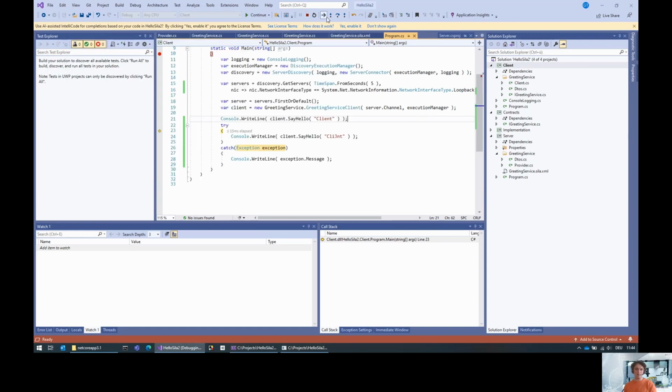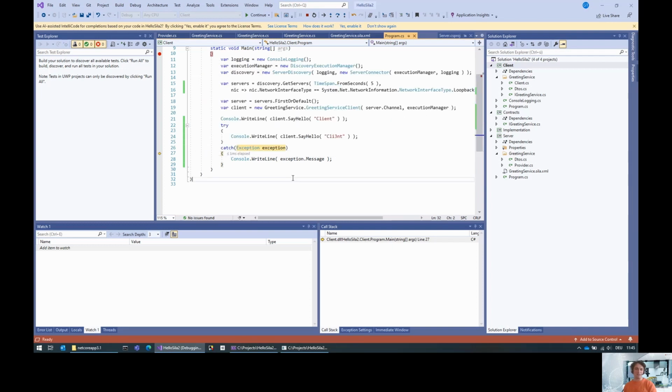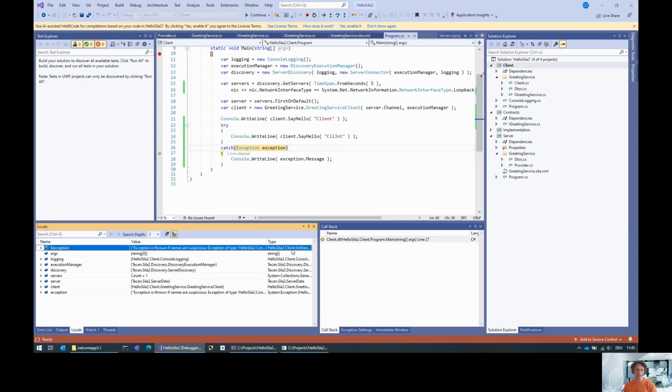And we do the hello client. Then we try to pass in something illegal. And there's an exception occurring. This exception is thrown if the names are suspicious. Exception of type unfriendly name exception was thrown. That is because we didn't specify a message. Otherwise, the message would be transported. But this exception here is actually of type client unfriendly name exception. So it's really the exception that's in the generated interface.